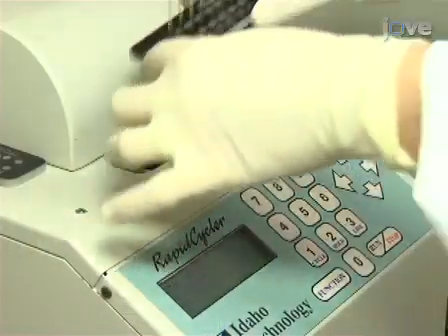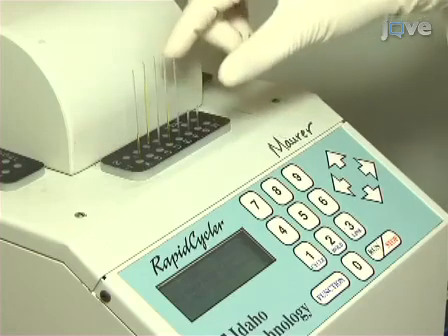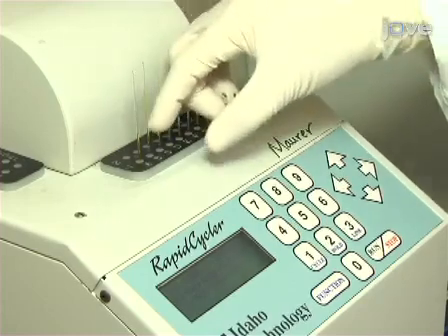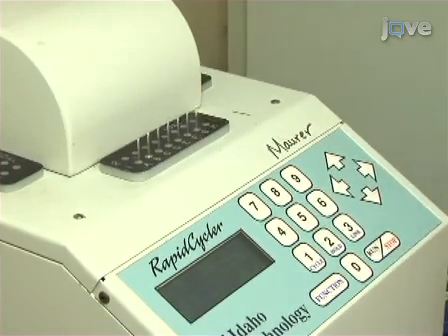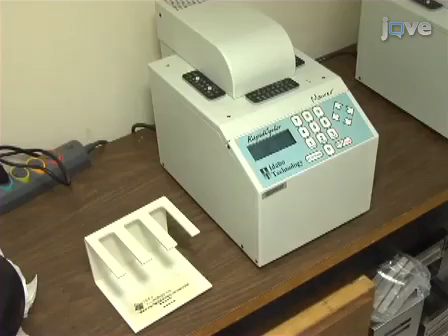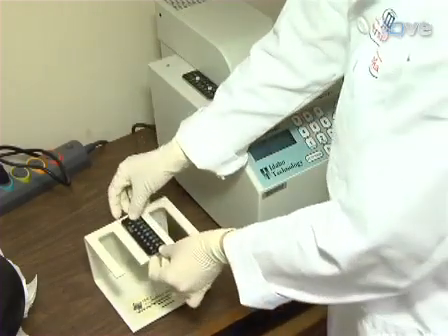Place the capillary tubes and holder into the Idaho Technology Rapid Cycler and use the thermocycler programs described in Table 1 of the written protocol for the different allelotyping PCRs. Once the thermocycler program is complete, proceed to the gel electrophoresis step.